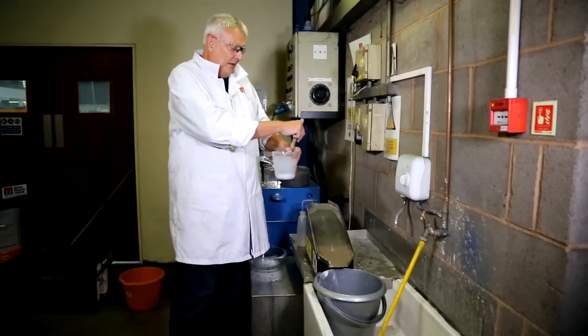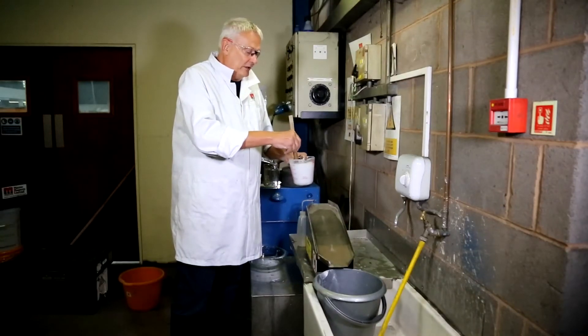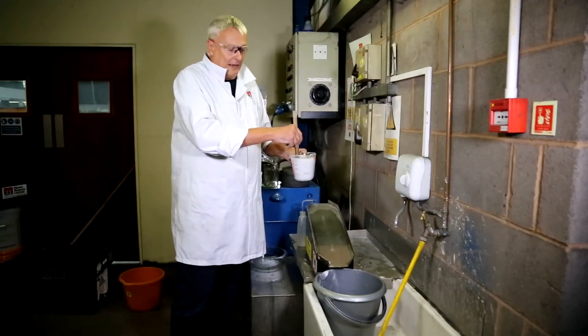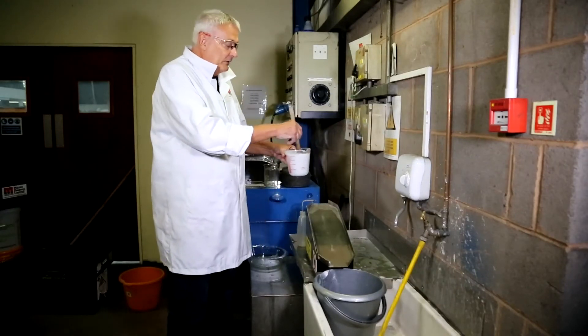Here I have a sample which is a mixture of kaolin and magnetite. Kaolin is a white material that is non-magnetic. The magnetite is Fe3O4, which is a ferromagnetic mineral and should be pulled out onto the surface of the magnet. And it's as simple as this.